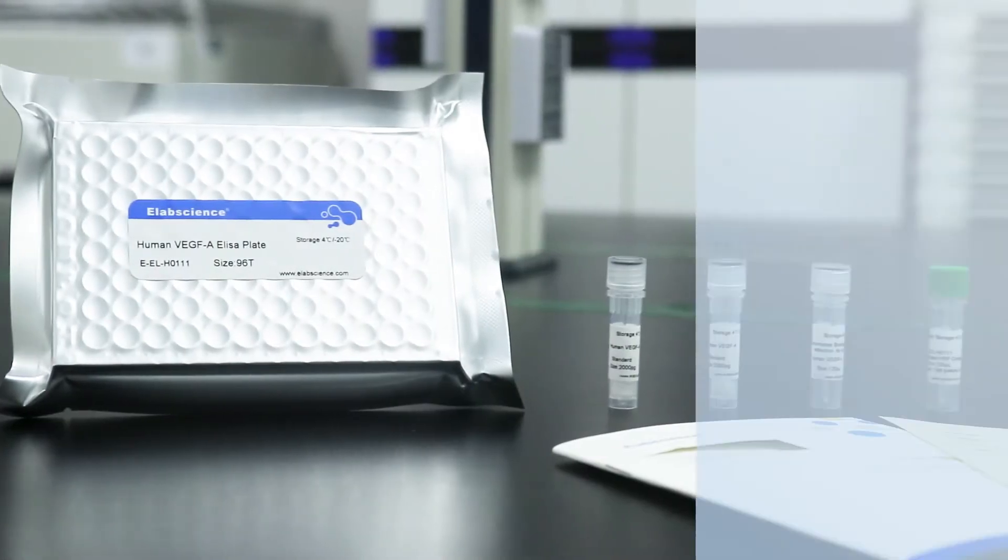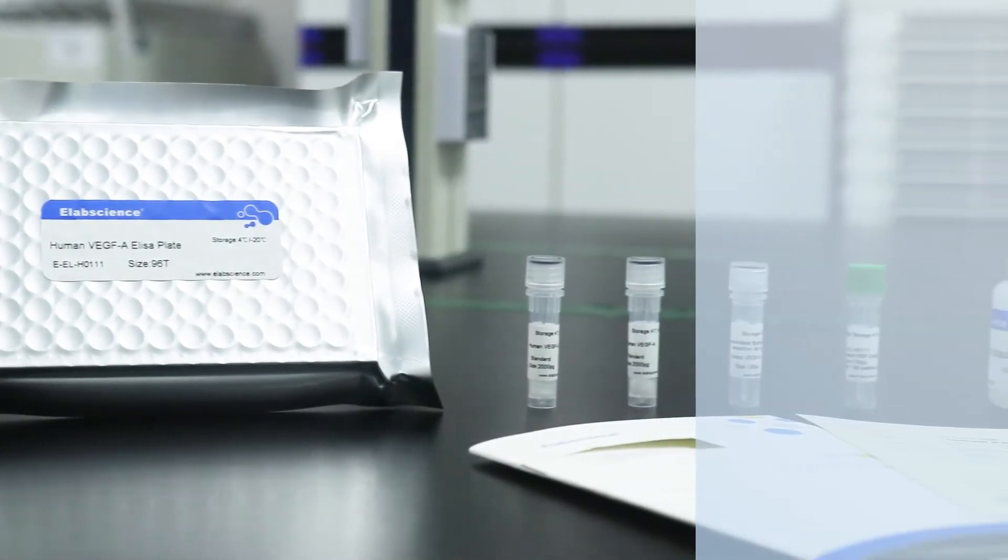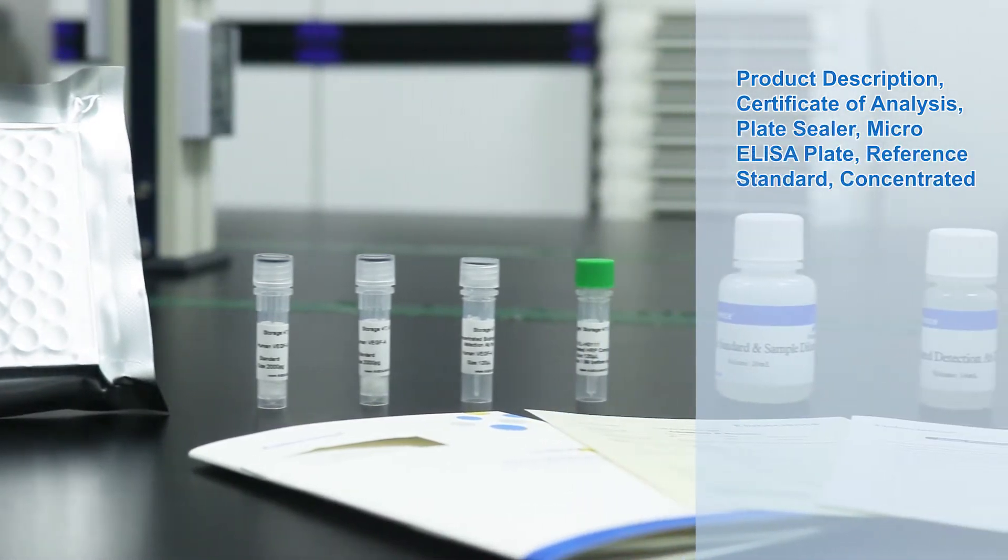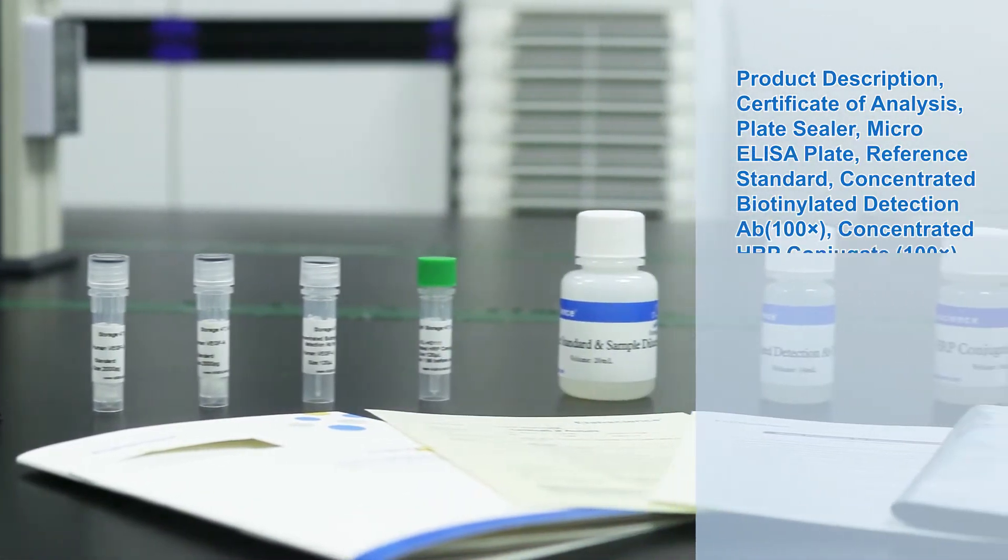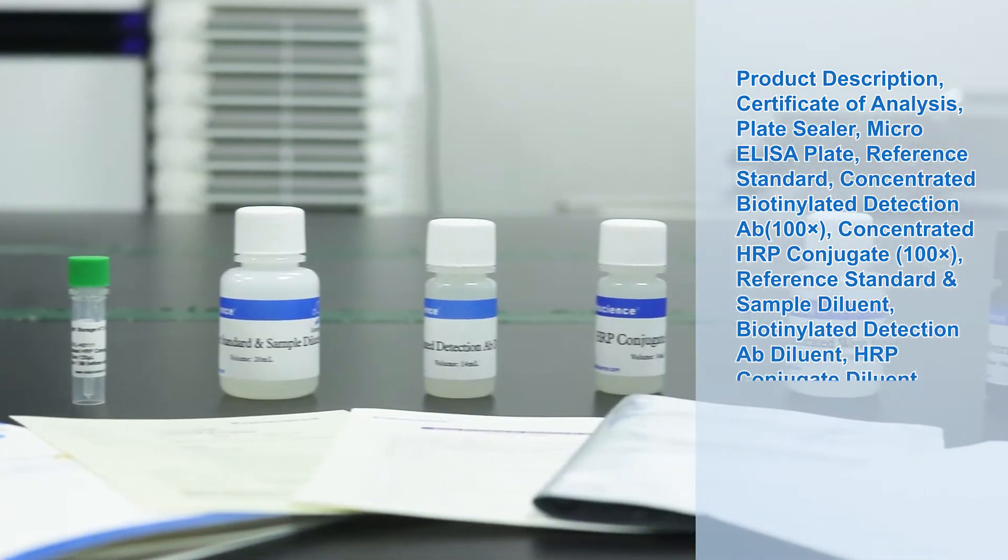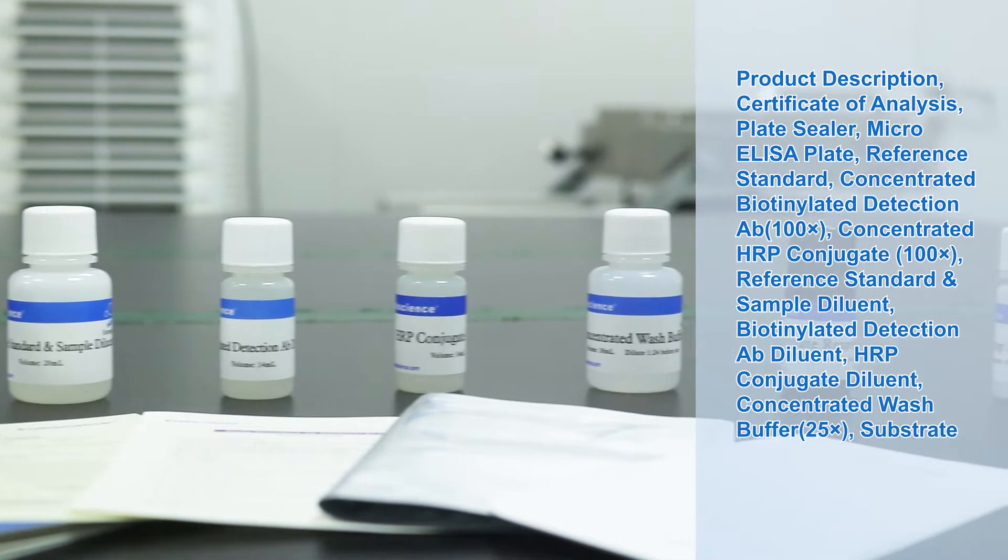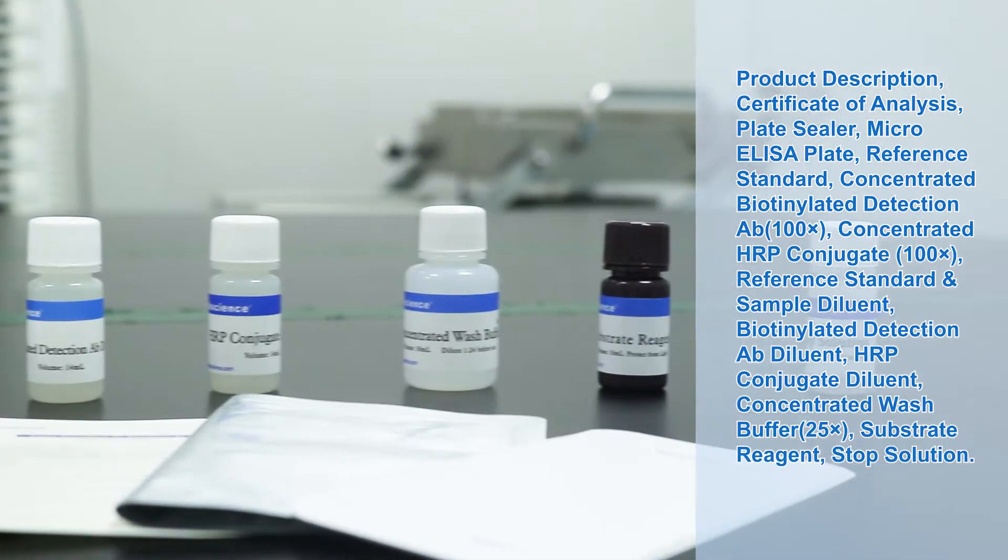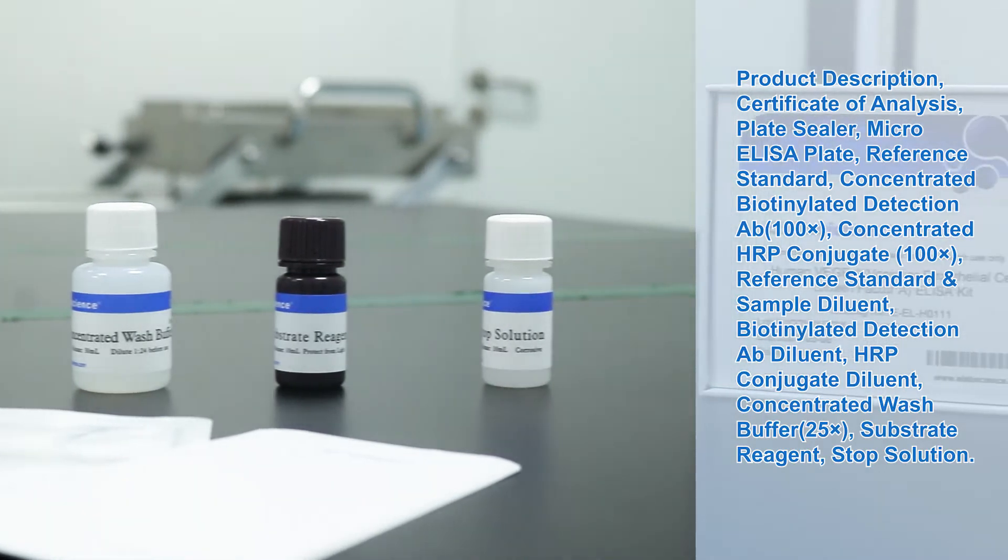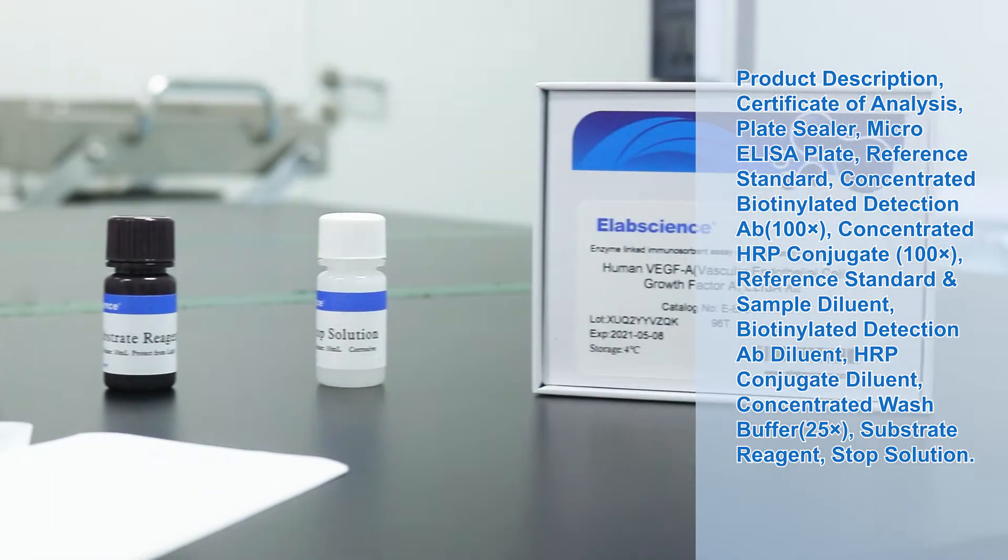Display of kit. Take out the kit, check its label and internal reagents, and read instructions carefully. If you have any questions, please contact the manufacturer in time to avoid unnecessary mistakes during the experiment, and pay attention to the specific expiry date from the label outside of box.